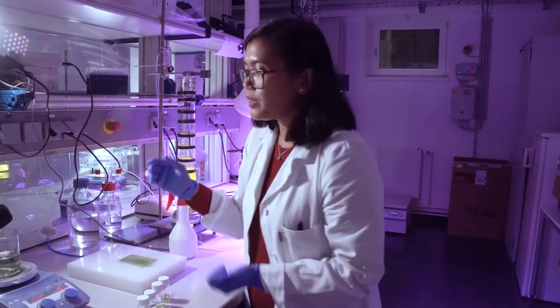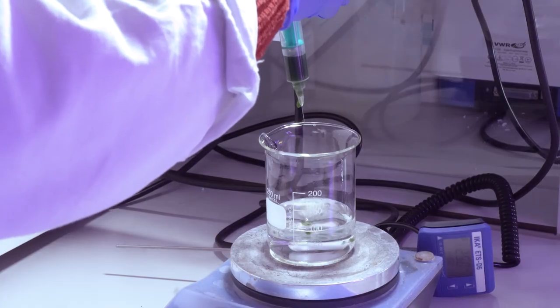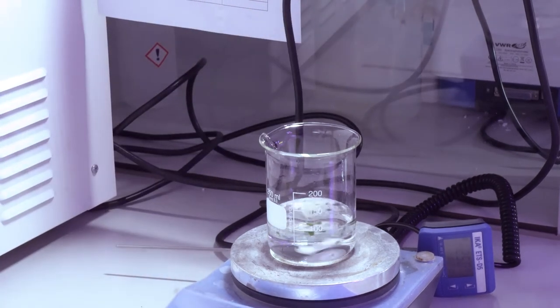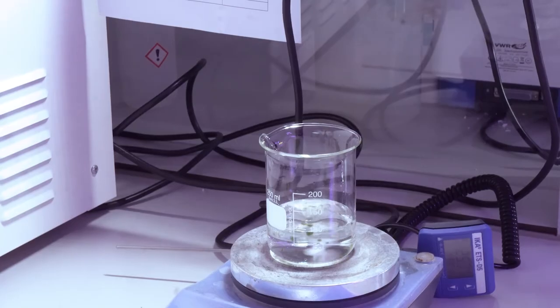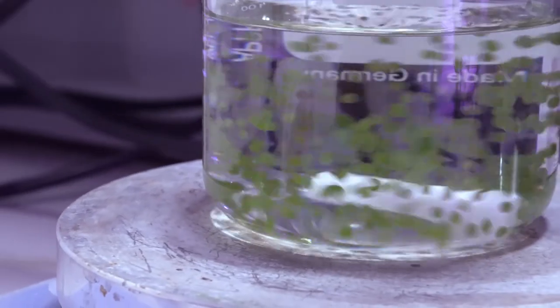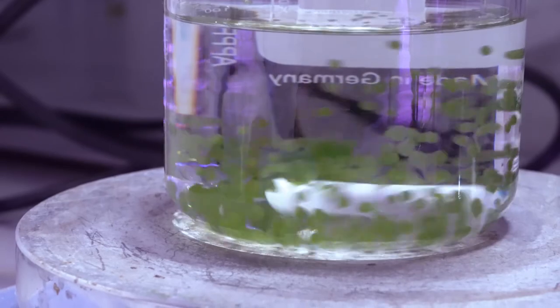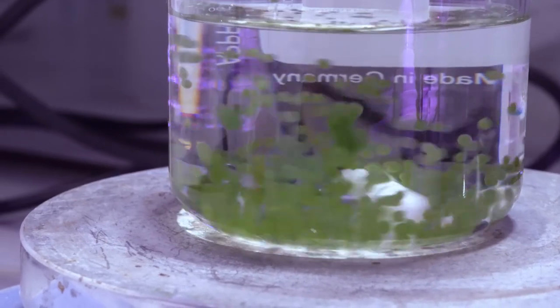For the beads, we use the same reaction mixture but just pass it through a syringe. As you can see here, we make around 1.5 to 2 millimeters of diameter for the beads system.